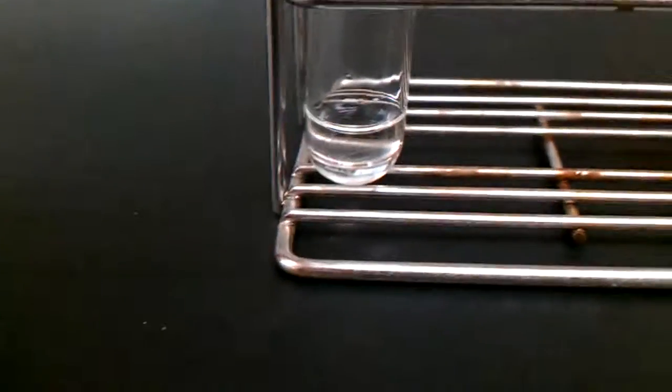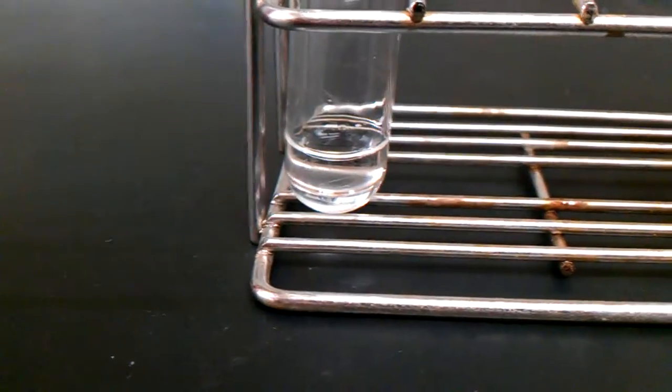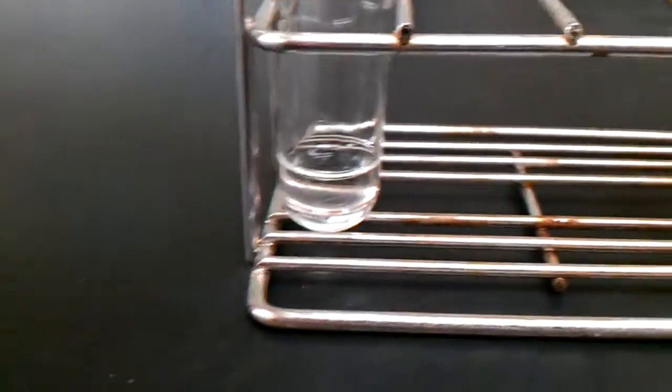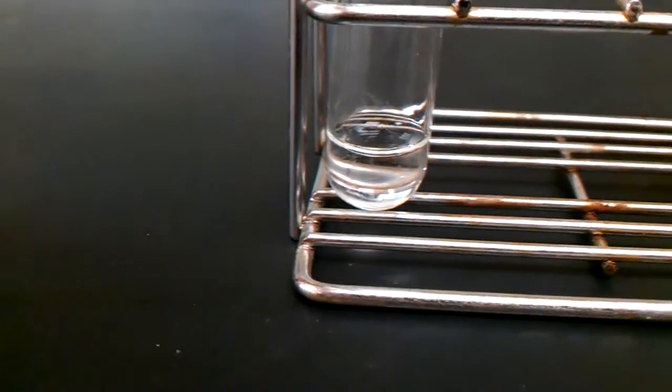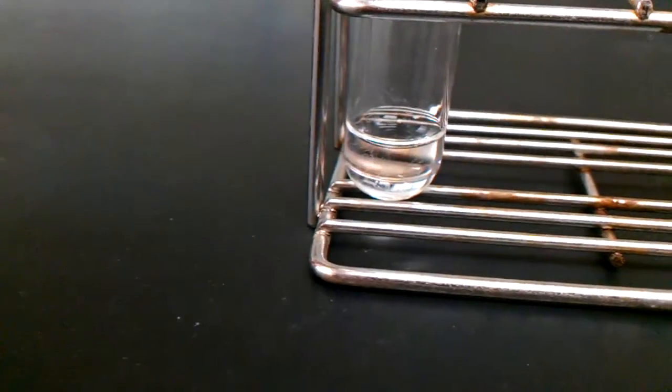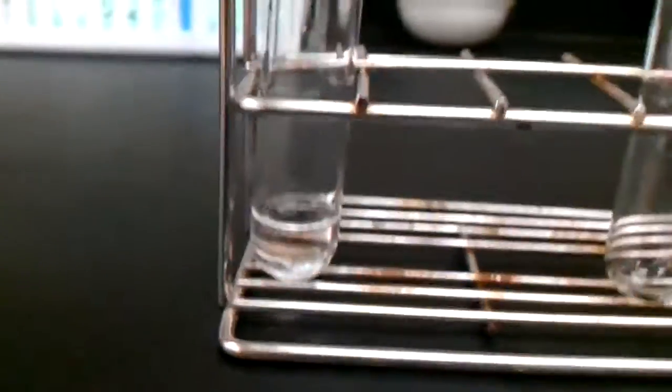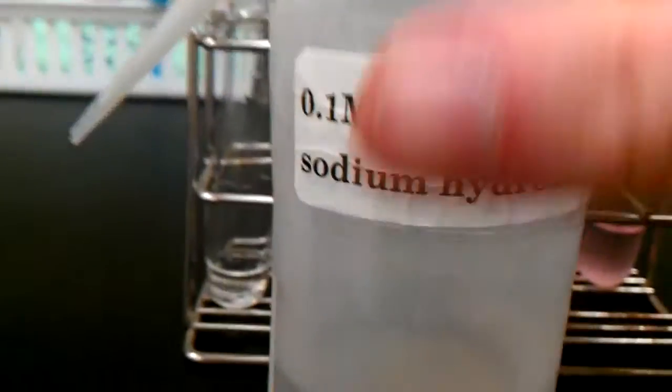Hi, today is Tuesday, April 23rd, 2013. I will show you a reaction with silver nitrate and sodium hydroxide, the first part.